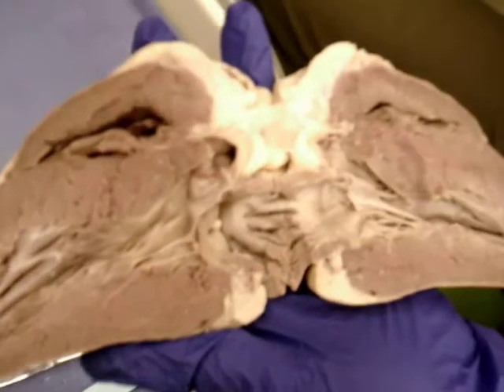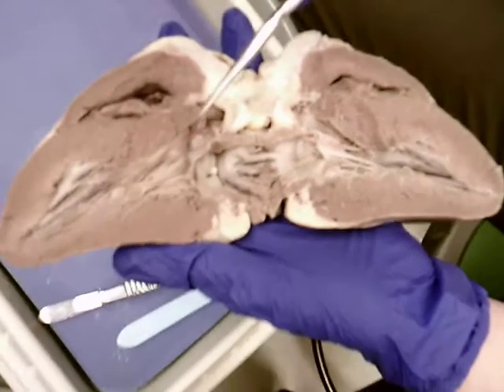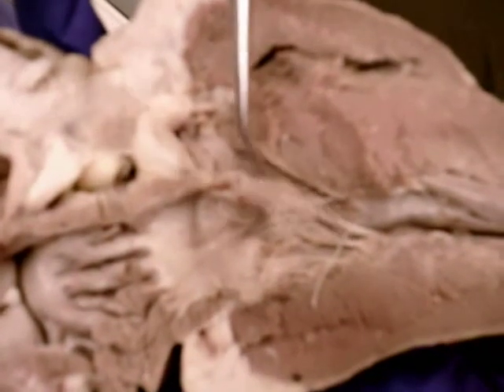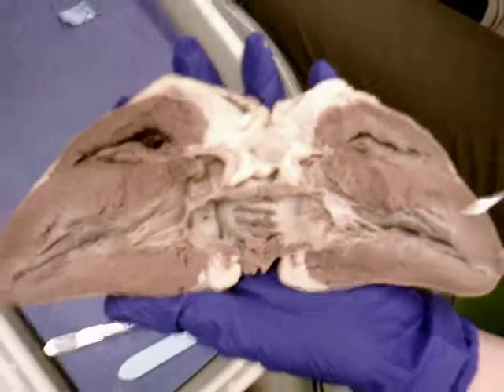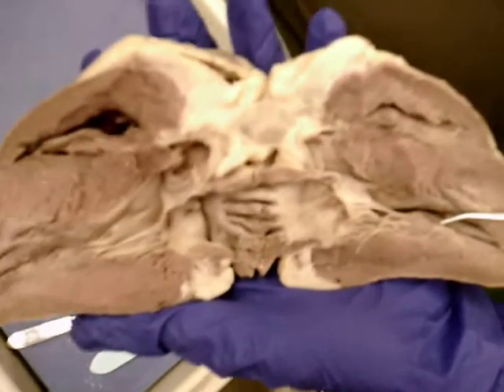Are those associated with strings called chordae tendineae? Mm-hmm. Alright, so here we see flap-like structures with strings attached. See them here and here? Again, both sides were on the left side. So these are the chordae tendineae, and these flap-like structures here are parts of the leaflets from the left AV valve. Good? Mm-hmm. Okay. Notice these thick finger-like projections of muscle that they're anchored into.